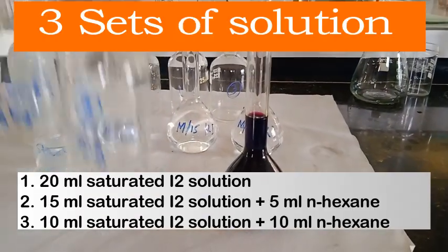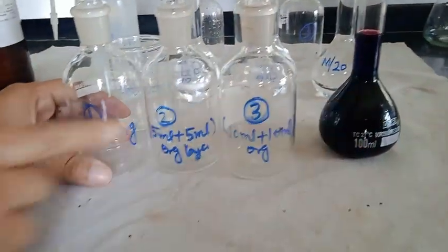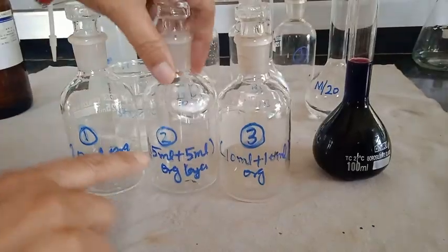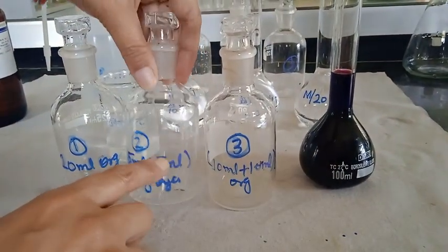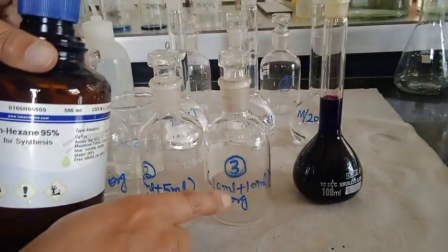To prepare three sets we have three reagent bottles, and to vary the concentration of iodine, we add 20 ml, 15 ml and 10 ml of the iodine solution.